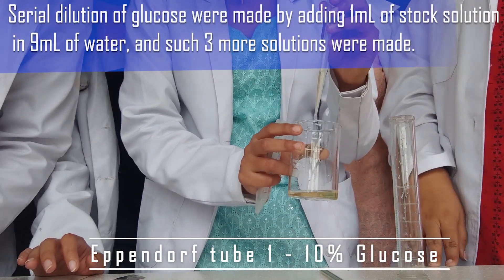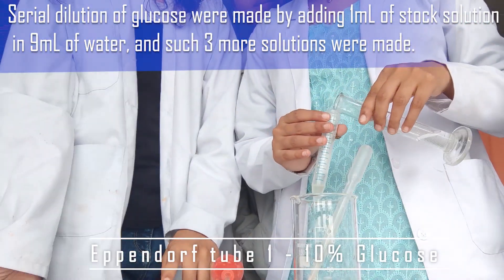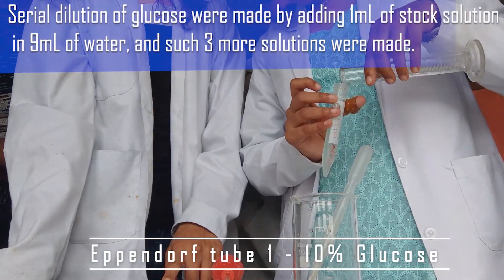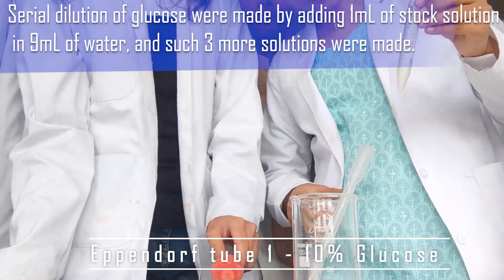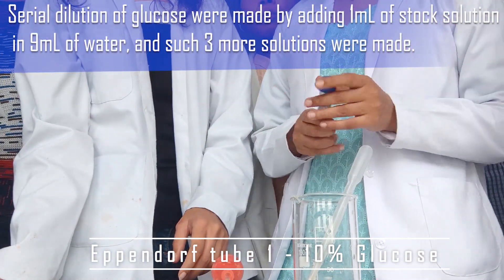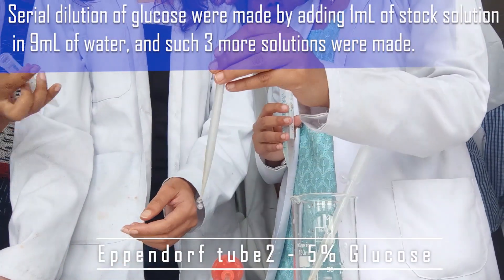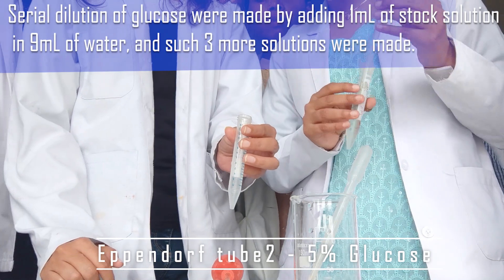We have four Eppendorf tubes. Take the first Eppendorf tube and add one ml of stock solution in it, then add 9 ml of water to make it up to 10 ml. This is our 10 percent glucose solution. Mix it properly.